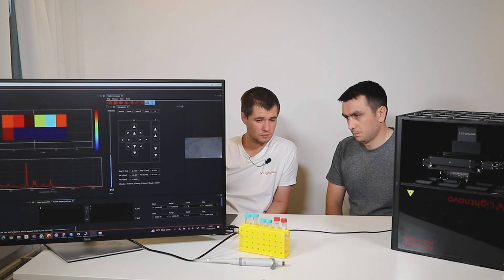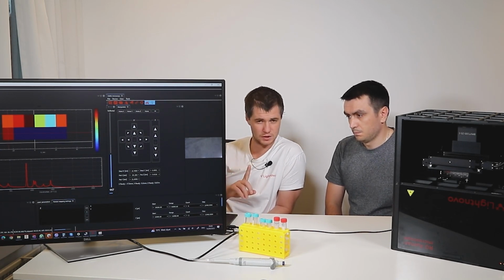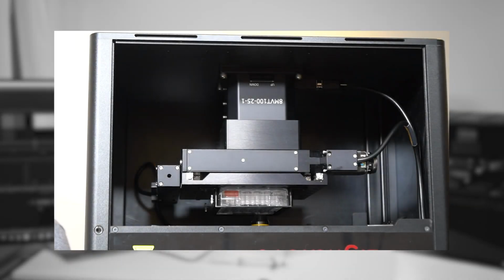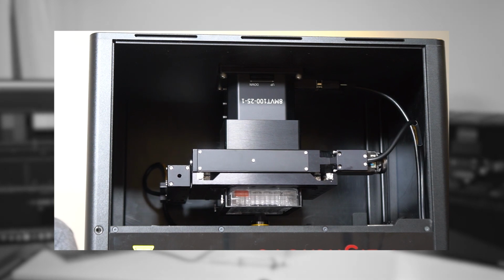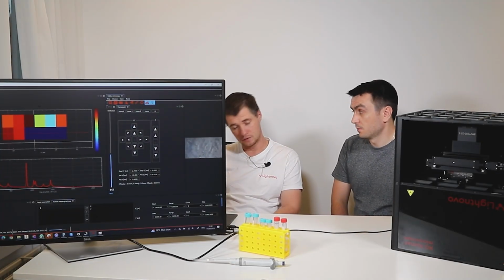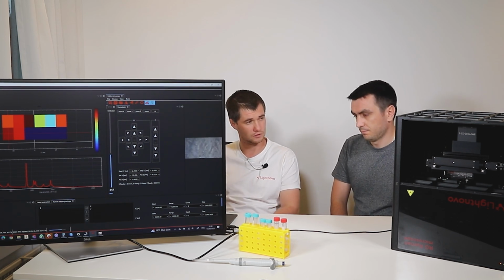The reason could be maybe not enough liquid in that cell, or maybe we have a little bit of mismatch in the center of the well for some reason. But for demonstration purposes, we can simply skip one point. We have an option in quantification if you don't like that, we can use some scaling procedures. And the peak ratio would still help us to use that point.